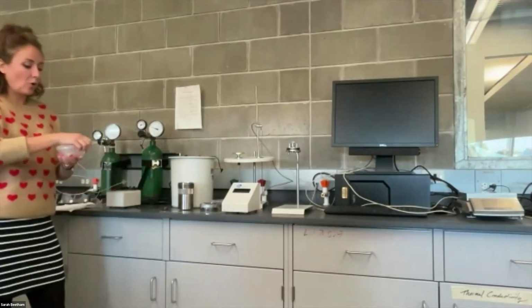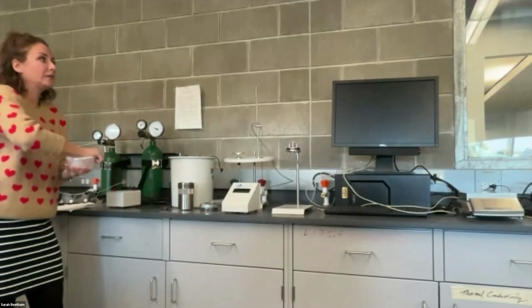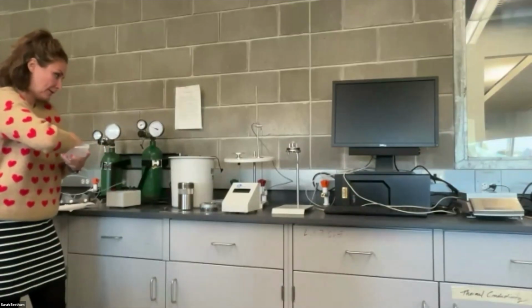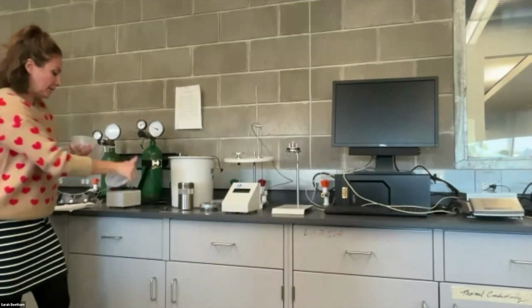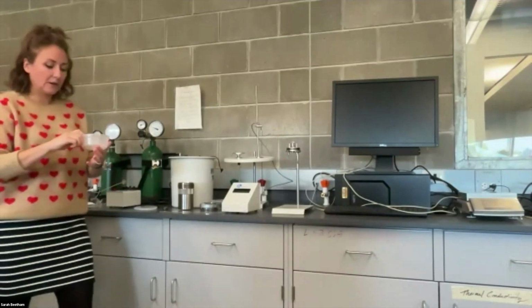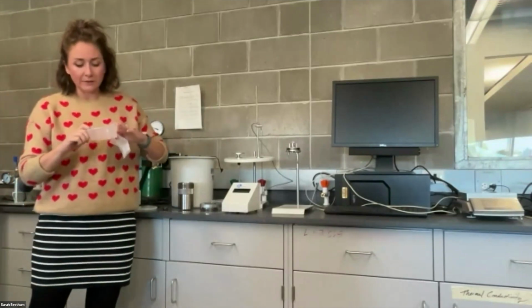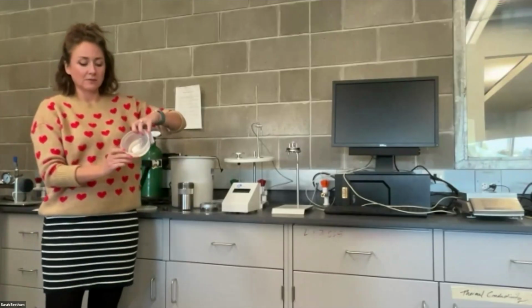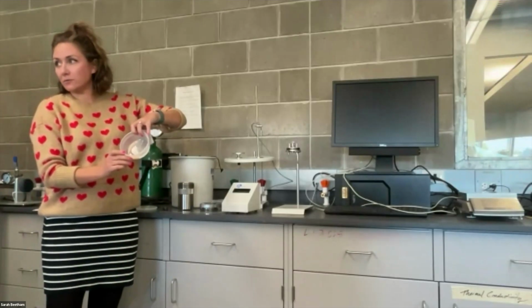And so now when you open up your food sample container, you will notice that there is a piece of weigh paper in here, a little fuse wire, which is going to be hard to see from far away from me, and then a gelatin capsule, so it looks like a little pill of crushed up food.